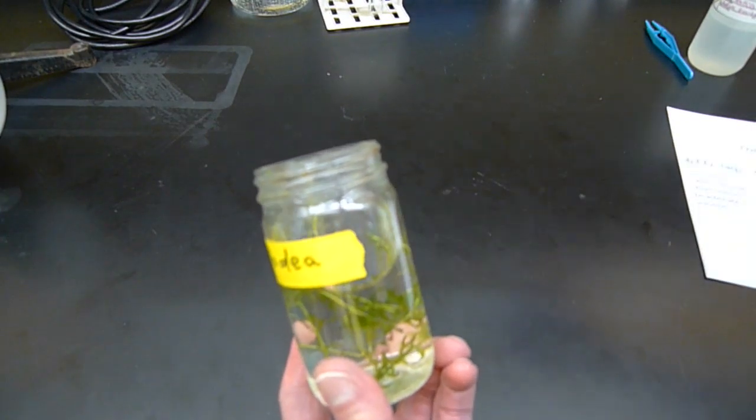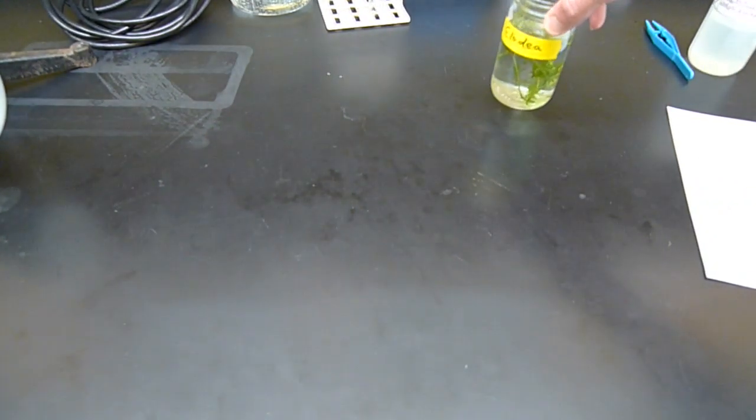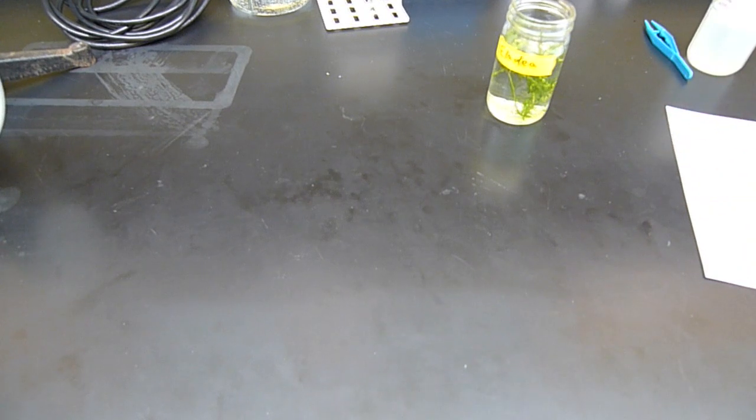So what I'm going to do is put Elodea in the tube, put in some of the bicarbonate solution, and that's going to be a volumeter. Shine some light on it, and then wait 10 minutes to see how long it takes to push liquid up into the tube. So we'll be back in a couple of minutes, and I'll be showing you construction of the Elodea in the solution and shining light on it.